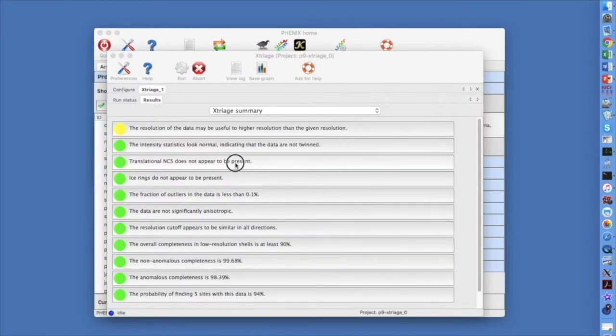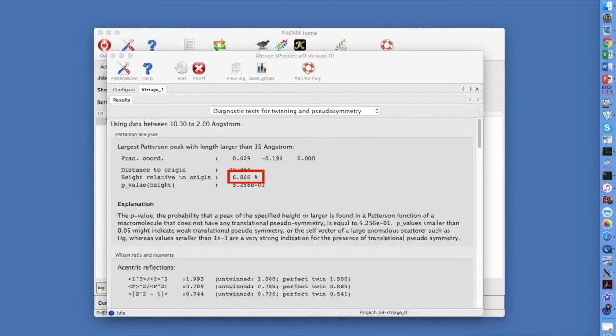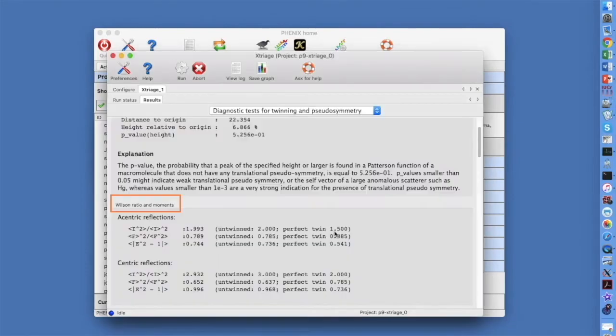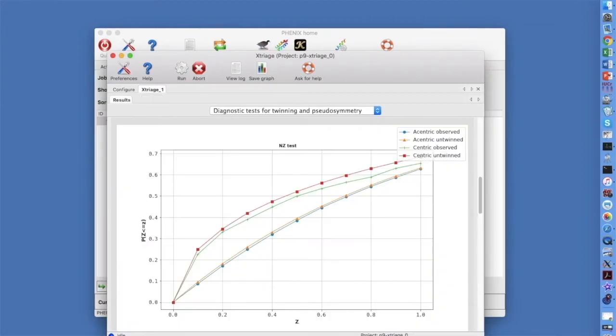We can click and see that the largest Patterson peak has a height of only 6.9% of the origin. 20% would mean that there is translational NCS. As there is no translational NCS, we can look at the Wilson statistics. For acentric reflections, the Wilson ratio is 1.99, very close to the expectation of 2 for untwinned data. A perfectly twinned crystal would have a value of 1.5. We can also look at a cumulative distribution plot of intensities. The observed distribution for acentric reflections in blue is similar to the expected distribution for untwinned crystals.